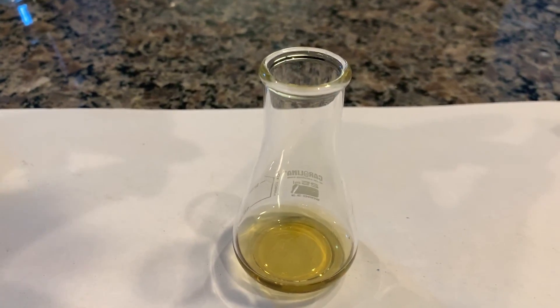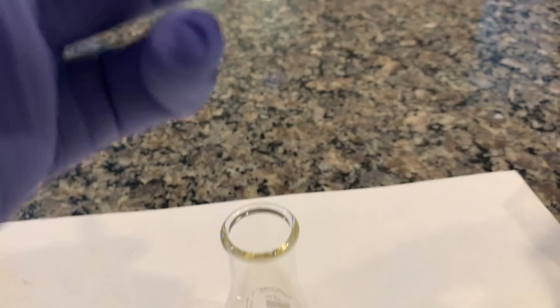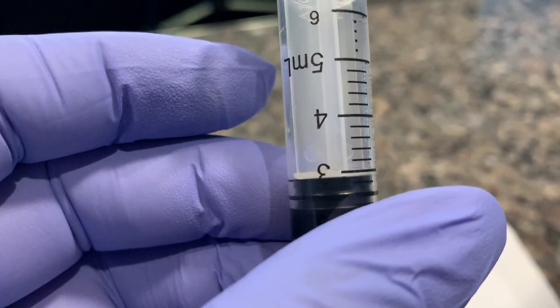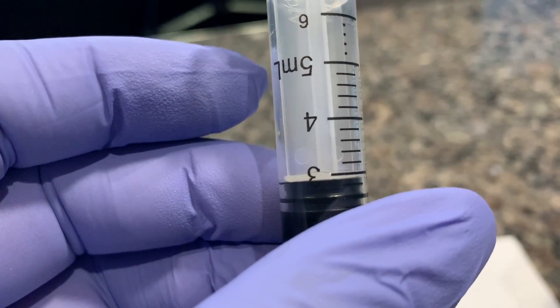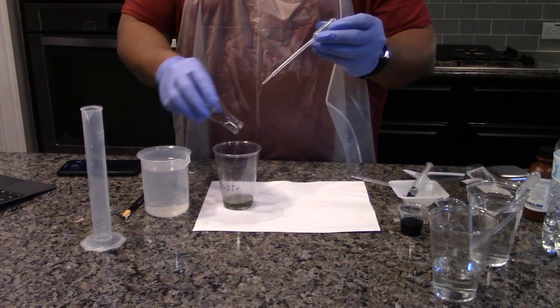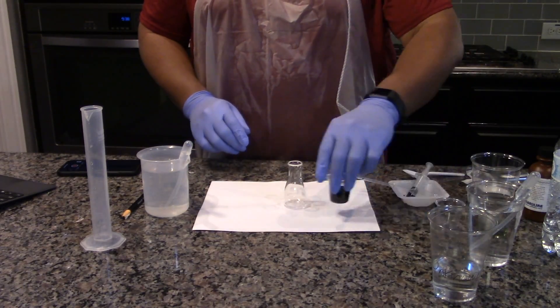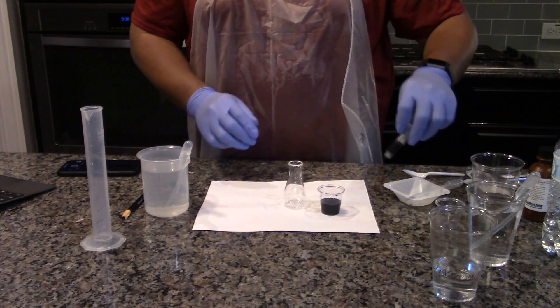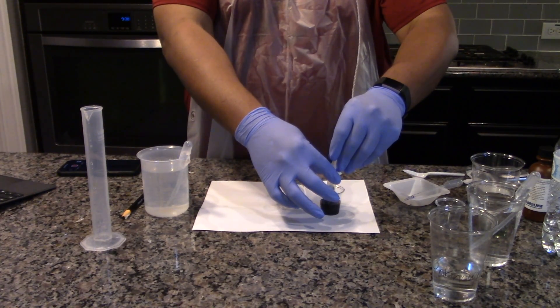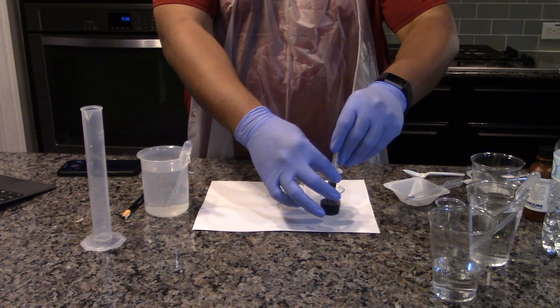Take a picture of the flask and record the final volume of the solution in the syringe. Empty the flask into the 10-ounce cup for waste. Rinse the flask with pure water from the beaker using the disposable pipette and empty the rinse water into the waste cup. Refill the syringe with DCPIP to the 5 mL mark.